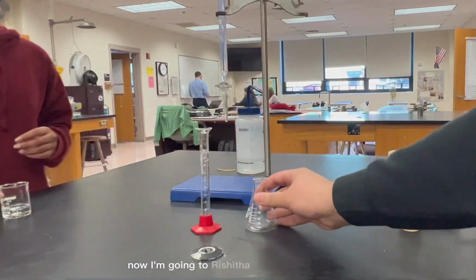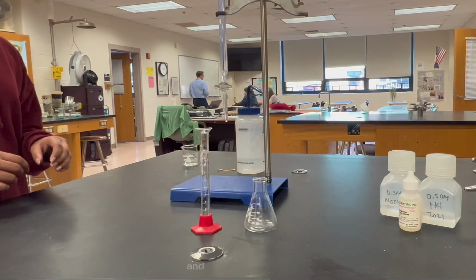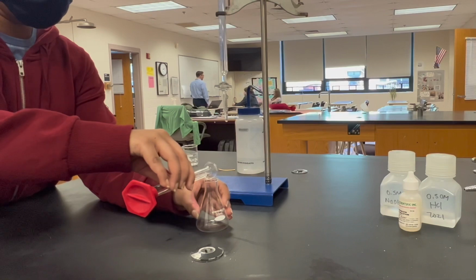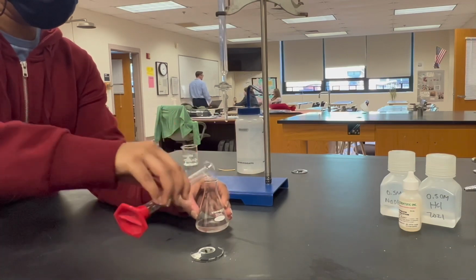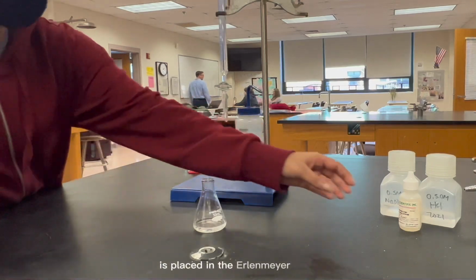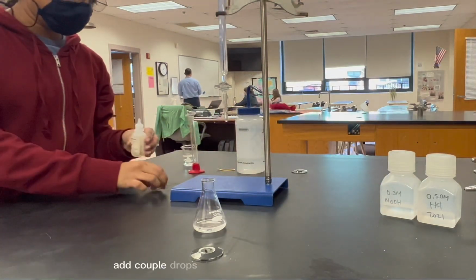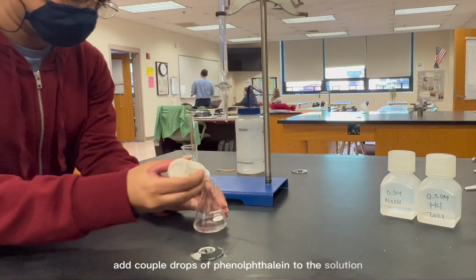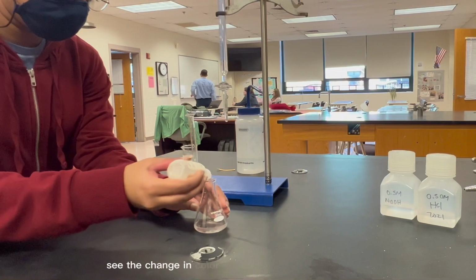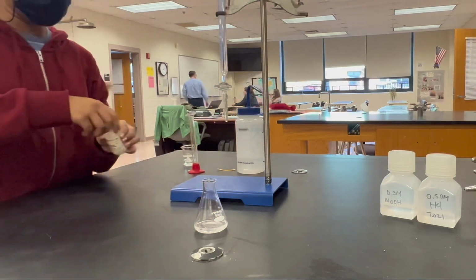Now, I'm going to hand Rishitha an Erlenmeyer flask that she's going to put the Sprite in and start the titration. After all the Sprite is placed in the Erlenmeyer flask, now Rishitha is going to add a couple drops of phenolphthalein to the solution. Again, the phenolphthalein is going to help us see the change in color as NaOH is added to the Sprite.